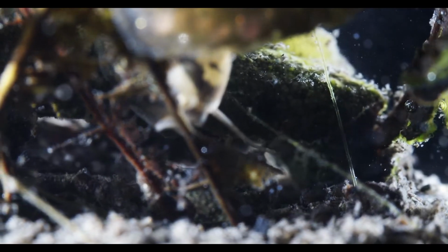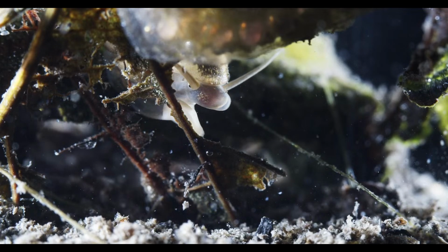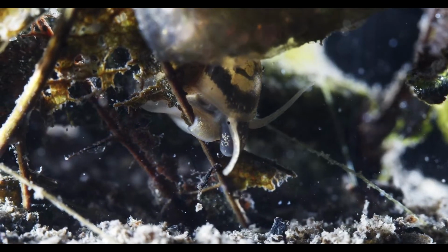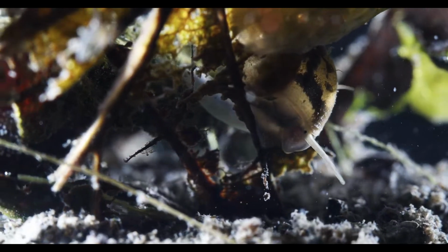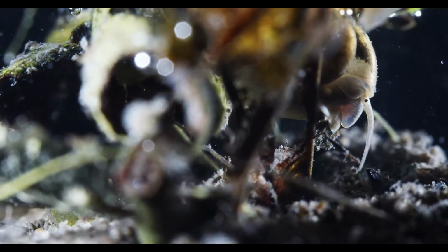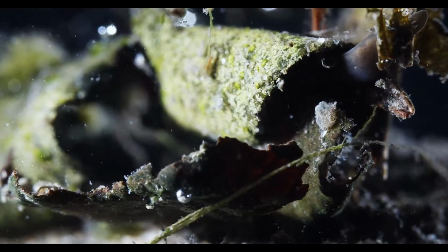I might just put that in later and we can revisit that, but there are worms that are really detritus feeders, others that are also predatory, and others that will eat biofilm mainly. There are so many different worms out there, not all of which are beneficial. And you'll be hard-pressed to identify them without at least this kind of magnification.